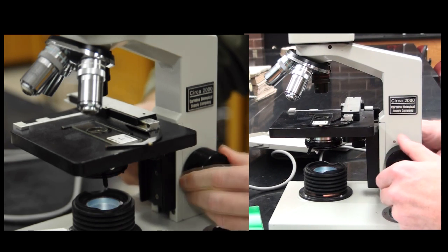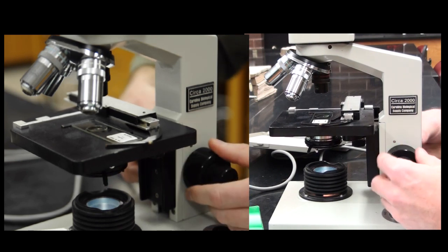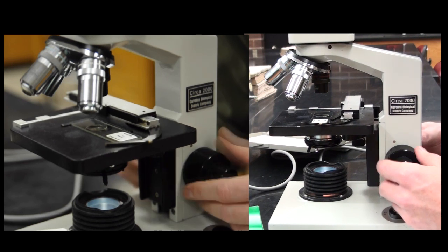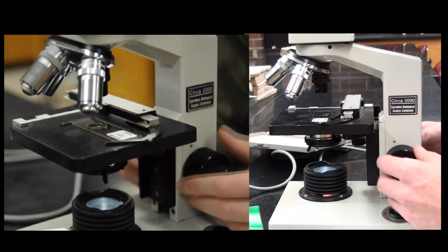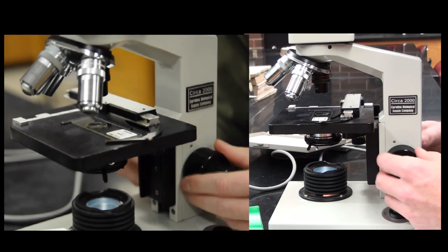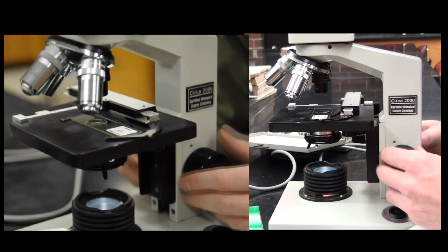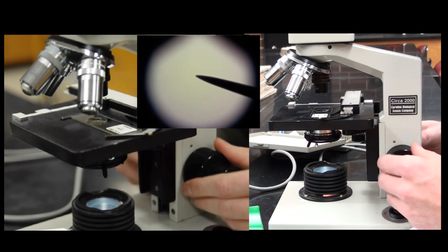Now what I can do is when I go to focus, I'll turn it counterclockwise to move it up. I can look through the microscope and gradually move it up, and hopefully my specimen will come into focus.